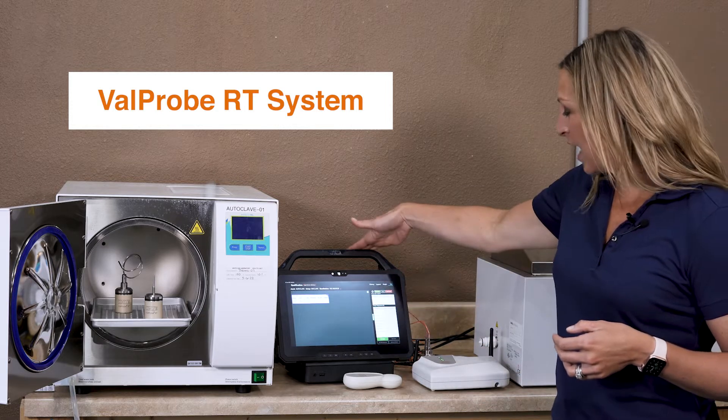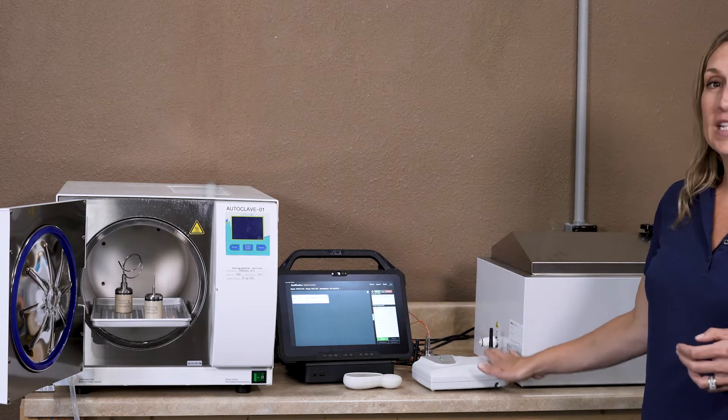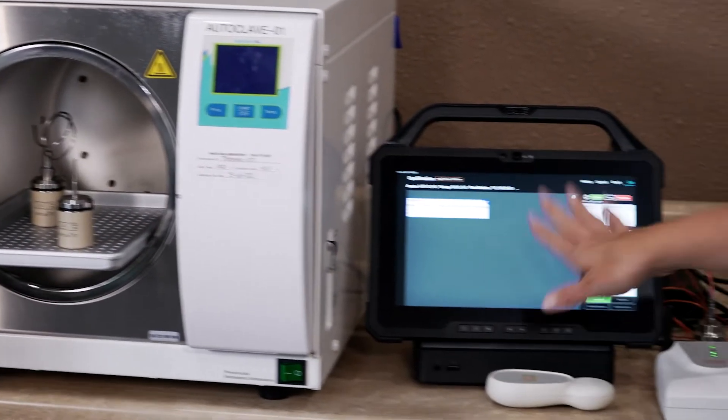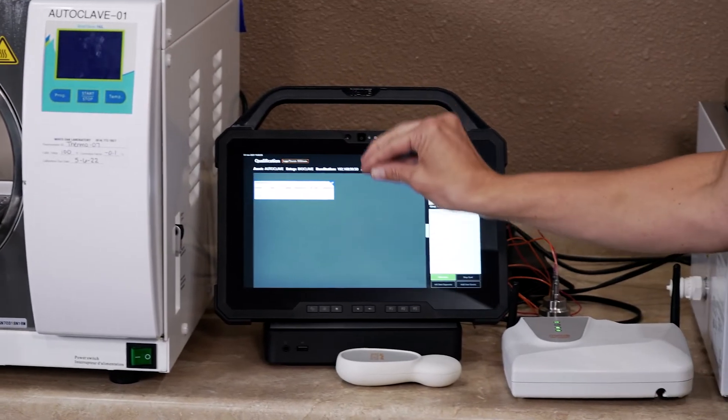It's the rugged tablet that communicates to the base station and the base station now communicates to the loggers. So you're getting real-time data fed to the tablet.